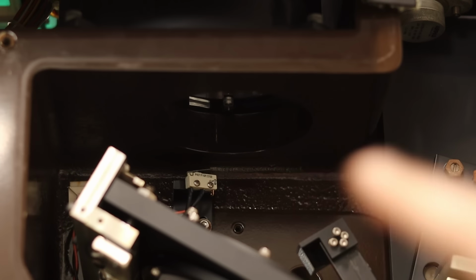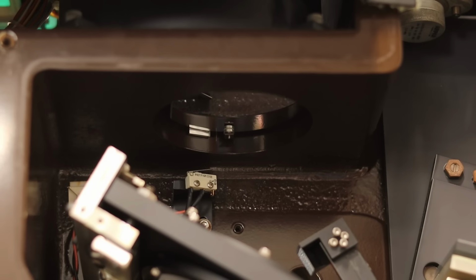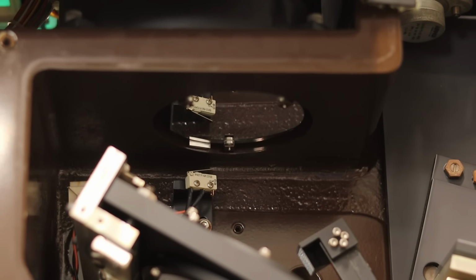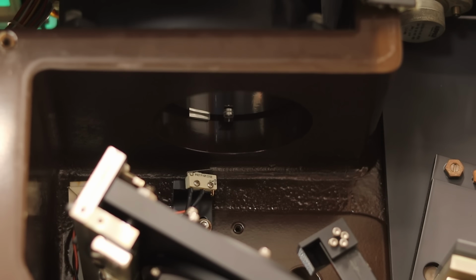Oh, here it comes. It's coming back. It's coming all the way down. It's gonna hit the limit switch. It's gonna go all the way back up. Right now, it appears to be scanning from limit switch to limit switch, and I don't know if I'm telling it to do that or if that's a problem, but that is awesome.